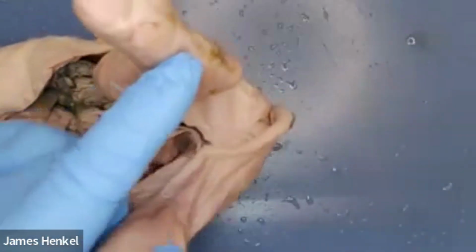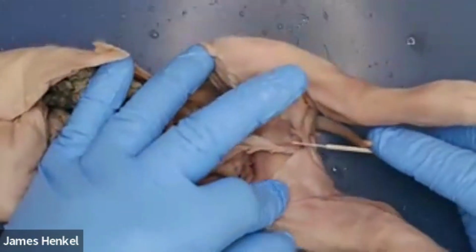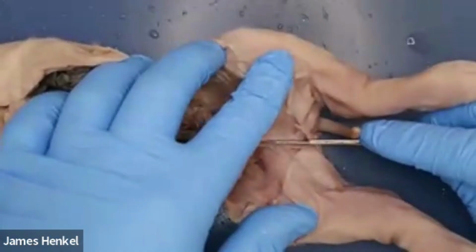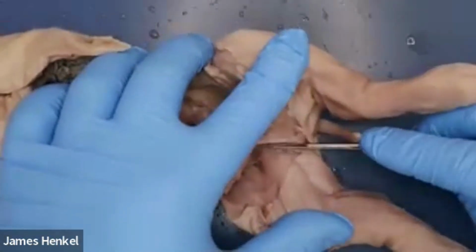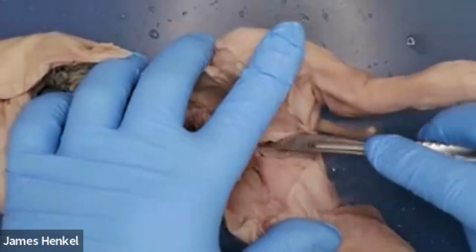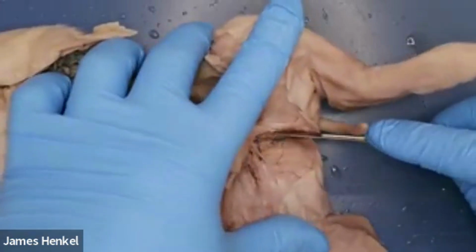opening, female. Now, we're going to have to cut a little bit farther into this to see the rest of the female reproductive organs. And you can see I'm going to cut directly and not sever that completely, just the piece of skin. And then I'm going to cut between the muscles in as straight a line as we can to the tail, or towards that urogenital papilla, which is underneath the tail. And as I'm pushing this apart, I'm cutting through multiple layers of muscle, and then I will get to the pelvic bone.